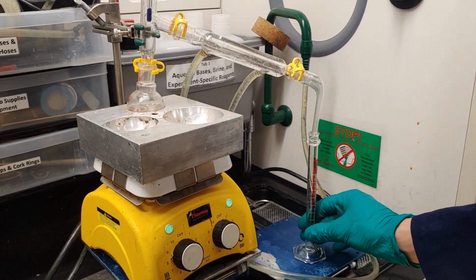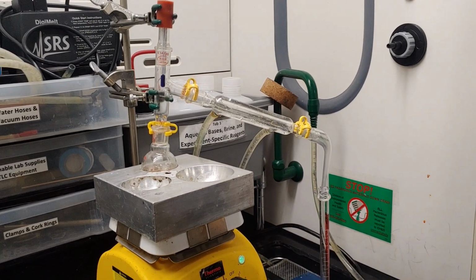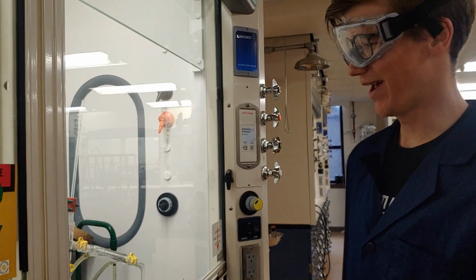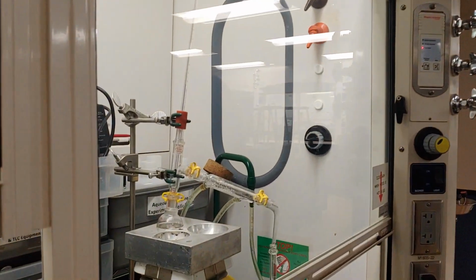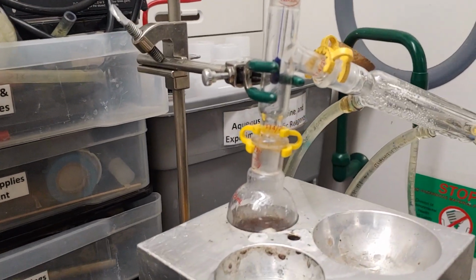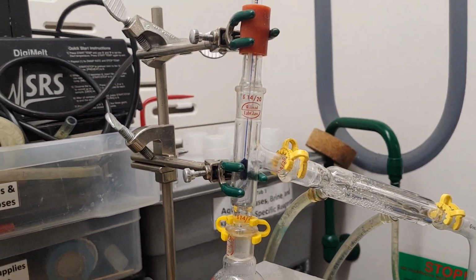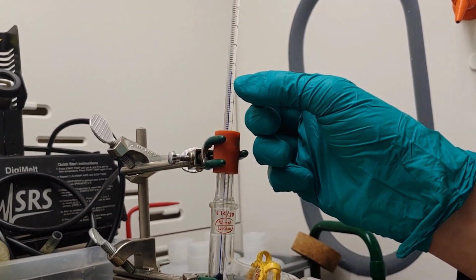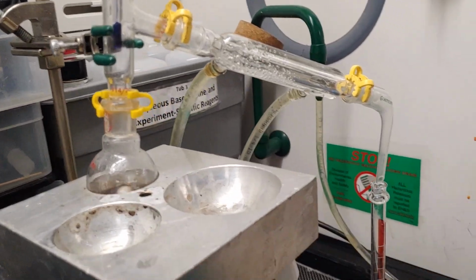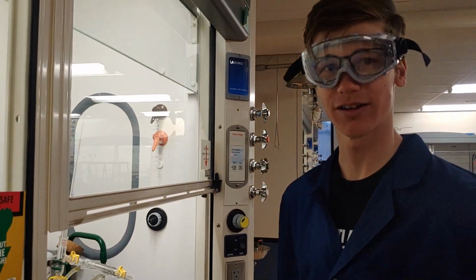And so now I'm going to monitor the temperature with the thermometer, and monitor until I get about 2 milliliters of liquid distilled. Back here, we're about 15 minutes into this reaction. As you can see, once I raise the fume hood up, the colors change pretty dark. Since the last time, I've lowered the thermometer a little bit, because I had it a little bit too high, but it still stayed about 23. Right now it's hanging out at 26, so it should be distilling here shortly. I will get back to you whenever we're ready to start distilling and make sure that you can see that process.